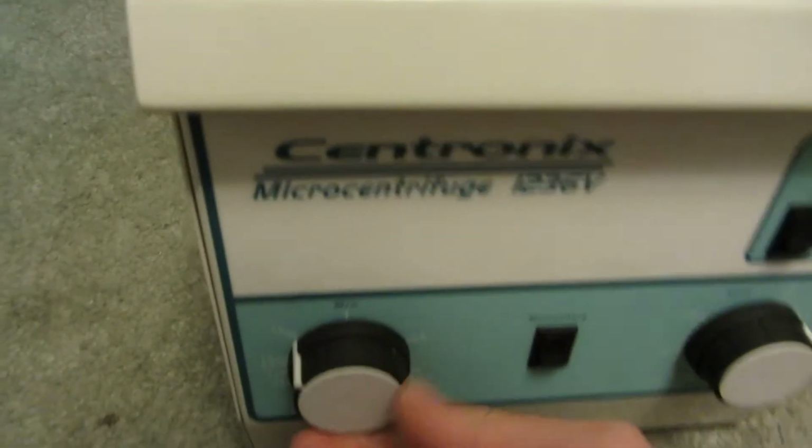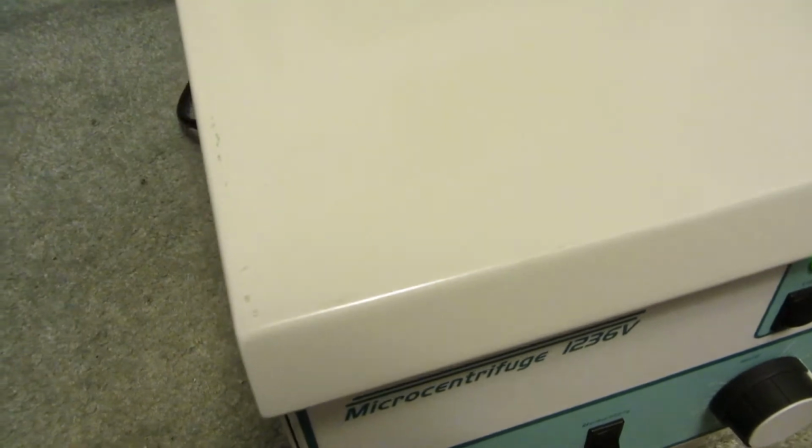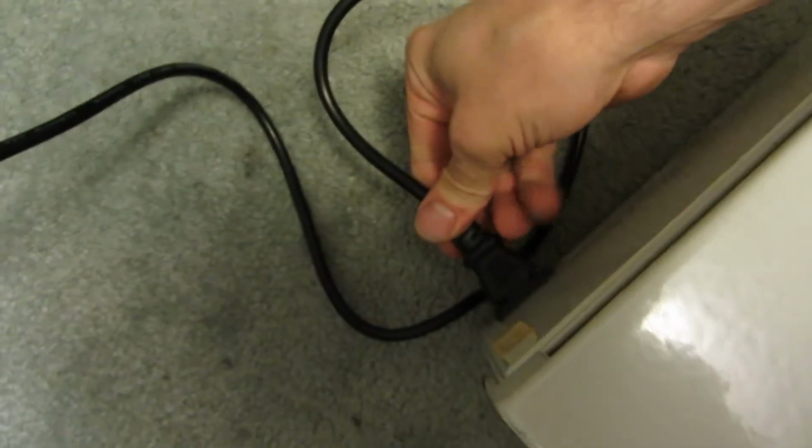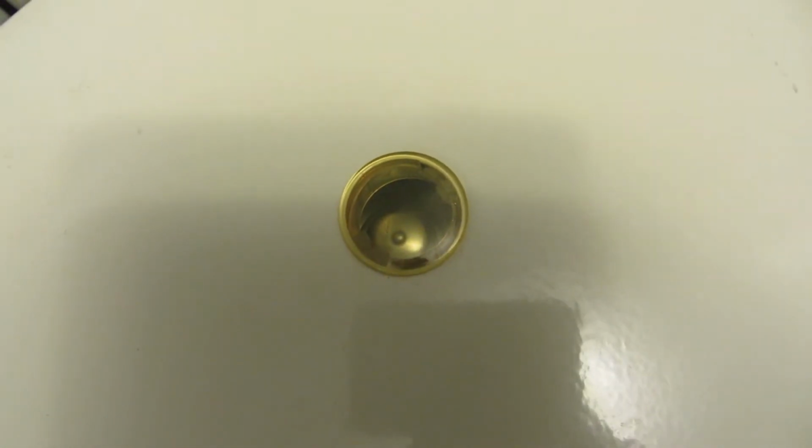Now I'll speed back up to full speed. And this time, I'll just unplug it. You'll see how much slower it takes to decelerate. You see, it's taking a lot longer to wind down. So there's a built-in braking system.